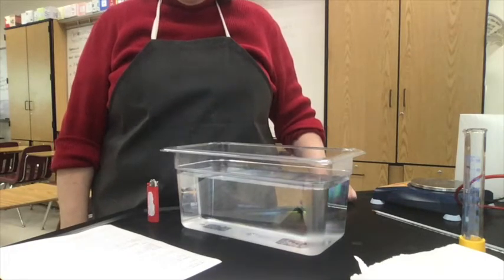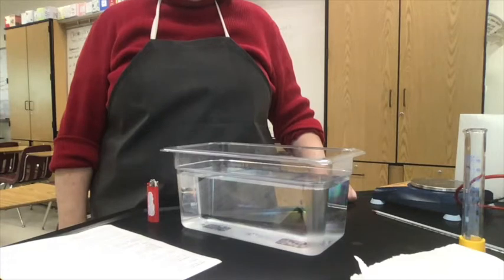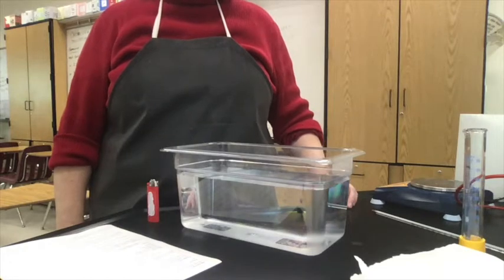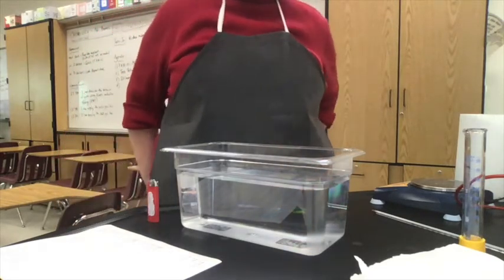We are going to be walking you through the ideal gas law lab. We're going to be showing you how to collect the data for each of the variables, walking you through the procedure and recording the data very closely for trial 1, and then we will do 2 more sets of data for trial 2 and 3, and you'll be actually reading those data pieces and recording them.